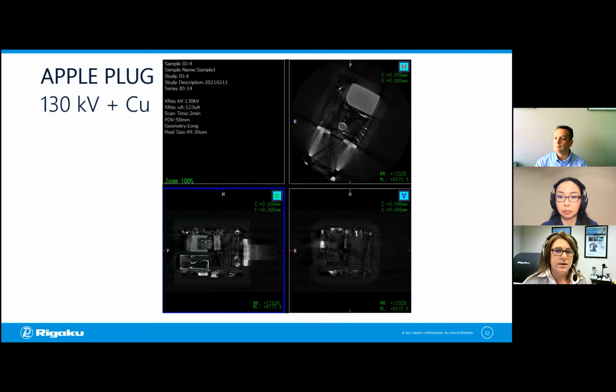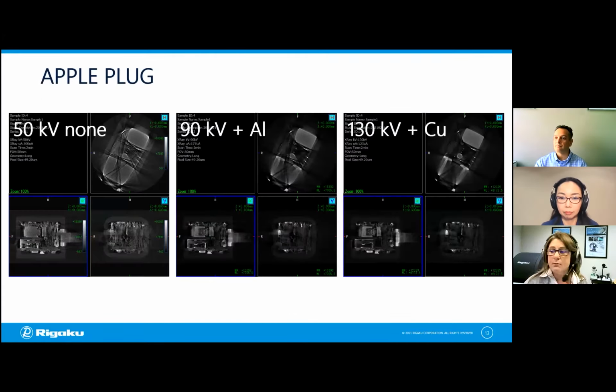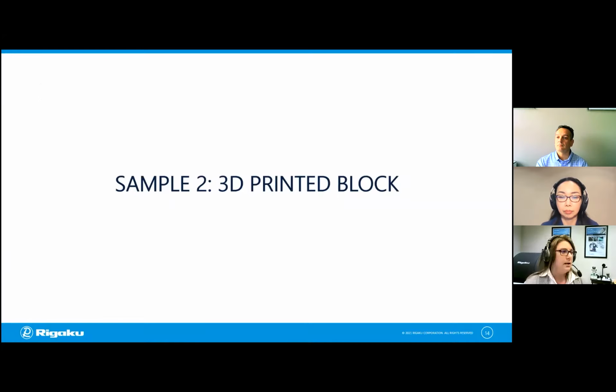Okay, so I'm going to move on to the next example. First let's do side by side. This makes it pretty clear now, doesn't it? There is some improvement that's made here. And in this case, these images illustrate that really well. So on our next slide, I'm going to get our sample ready while Aya tells you about it.